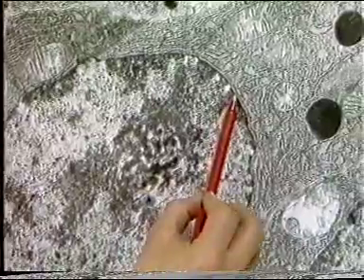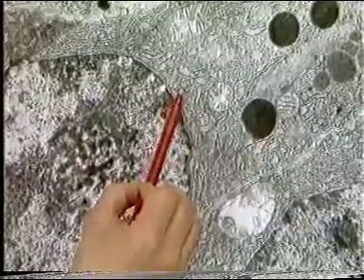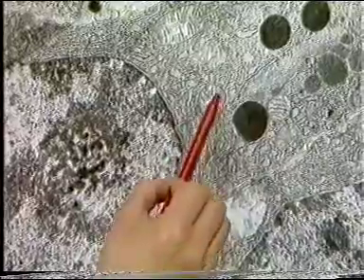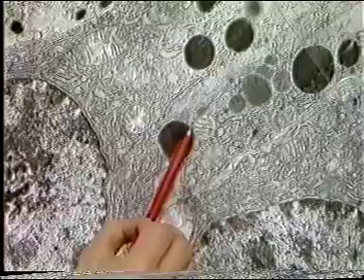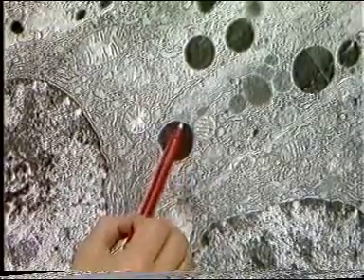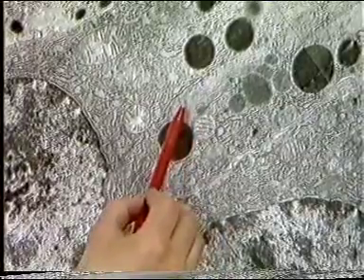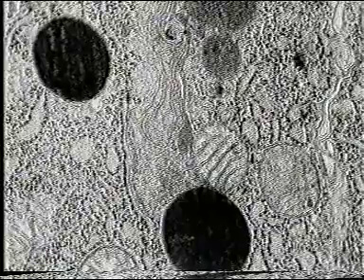And when we move on up the cell, towards the top of the nuclear envelope, there is more rough endoplasmic reticulum, a mitochondrion, and here what could be a secretory granule. This would contain enzymes. And here is the Golgi apparatus. If we look at this in more detail, we can see sacs of what are called Golgi cisternae. And at one end, we can see a number of what are probably condensing granules which are being packaged by the Golgi body.